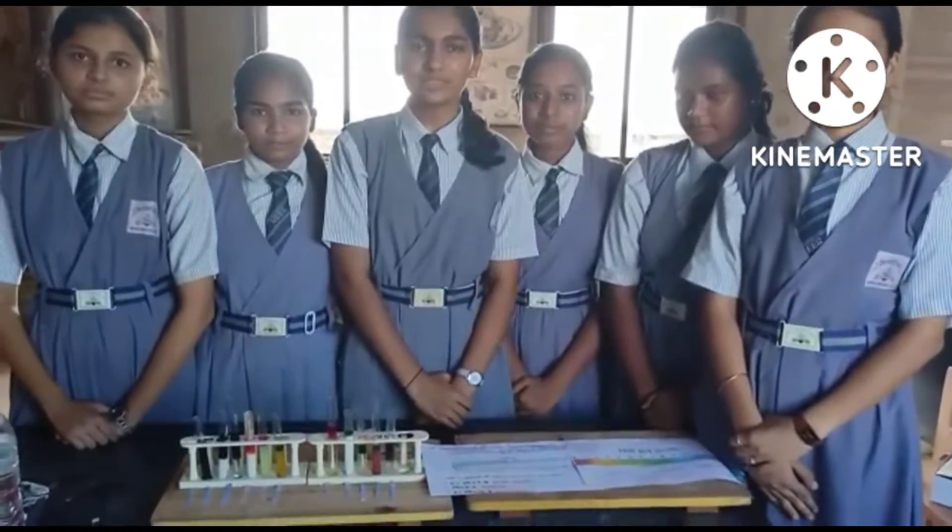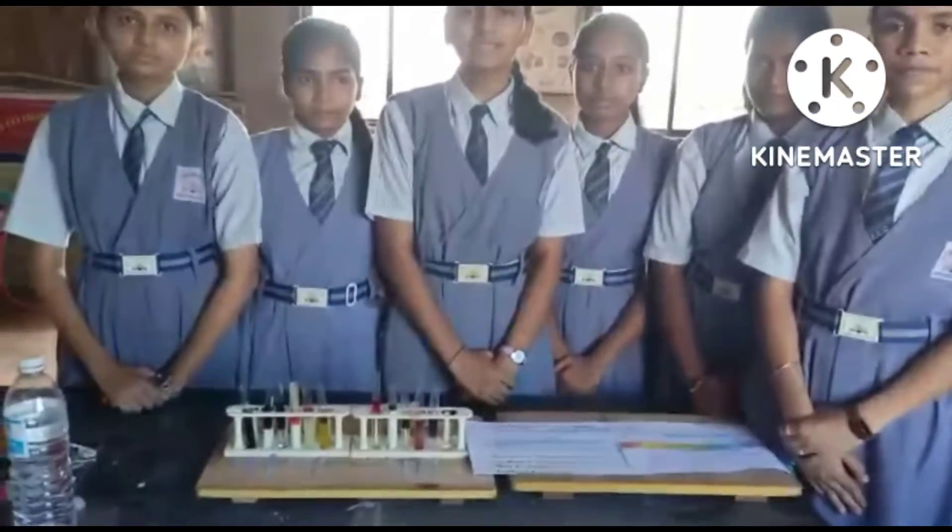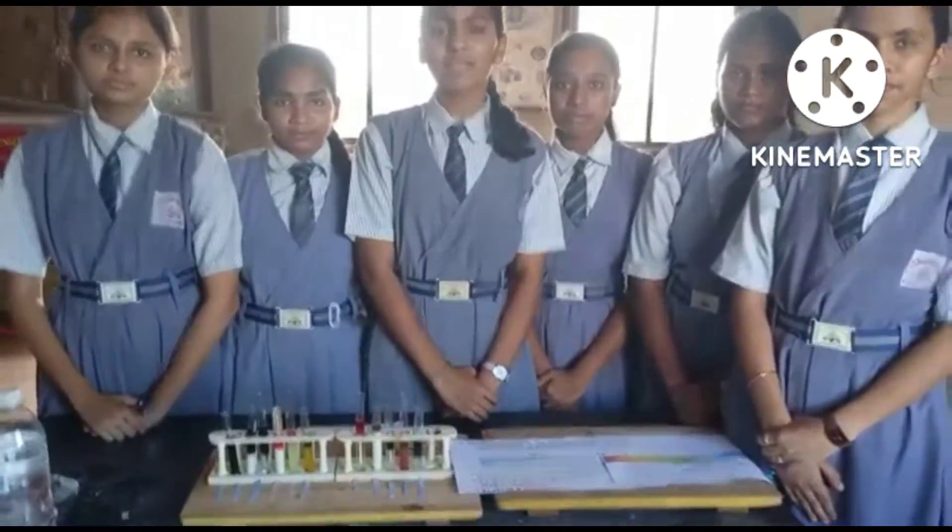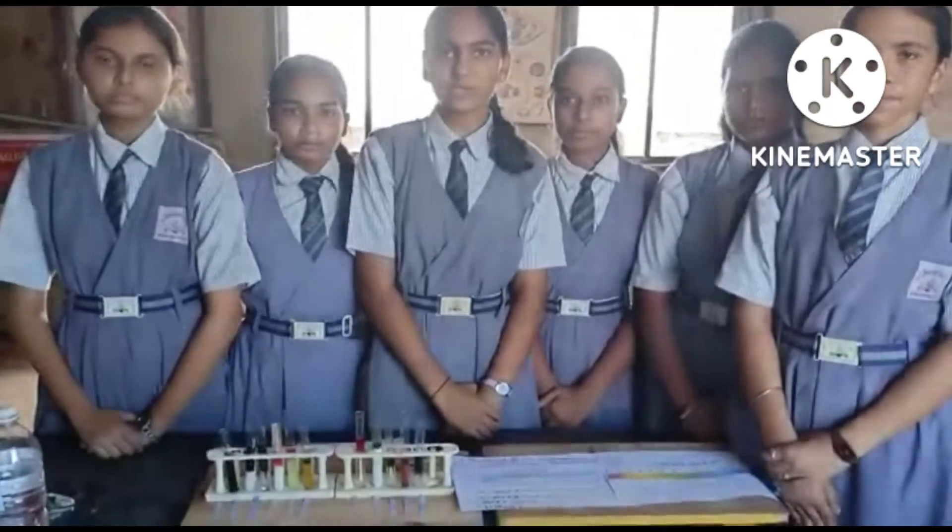We are the students of Nevena English School Chintool. The name of our group is CV Raman. Today we are performing an activity of checking the pH level of different solutions.